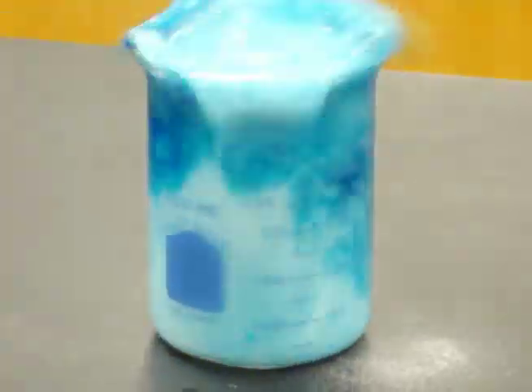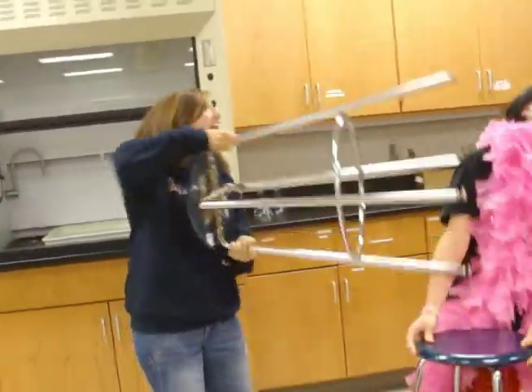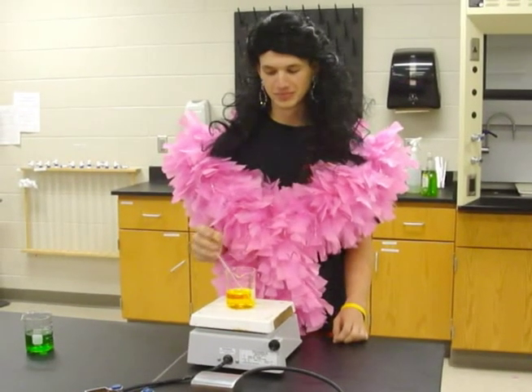Mix is not easy to fix. Go and get a teacher, then clean it up quick. Horsing around is a big mistake. You can get hurt if something breaks. Glass looks the same if it's cold or hot, so handle with tongs or it will hurt a lot.